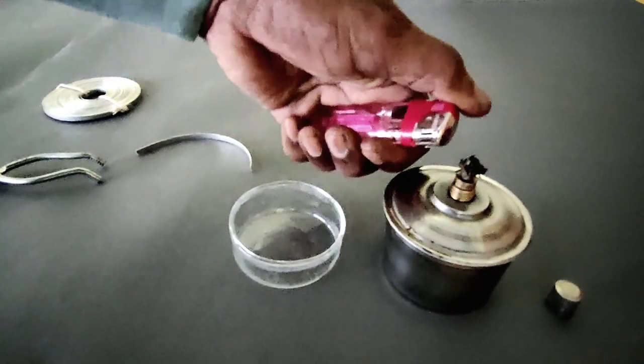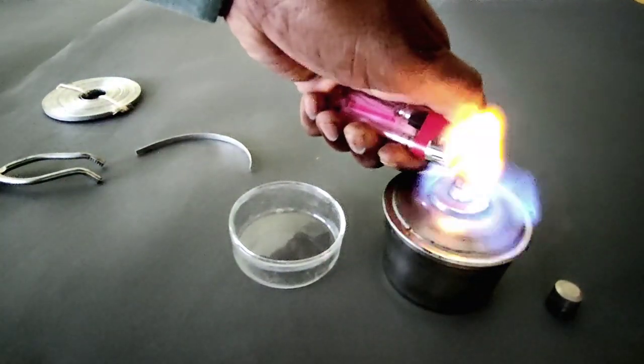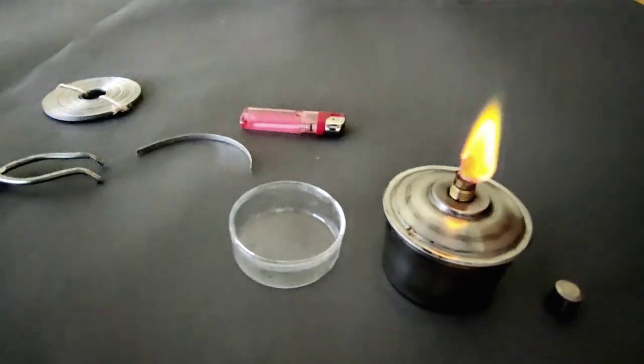Light the spirit lamp. Take a small piece of magnesium ribbon.